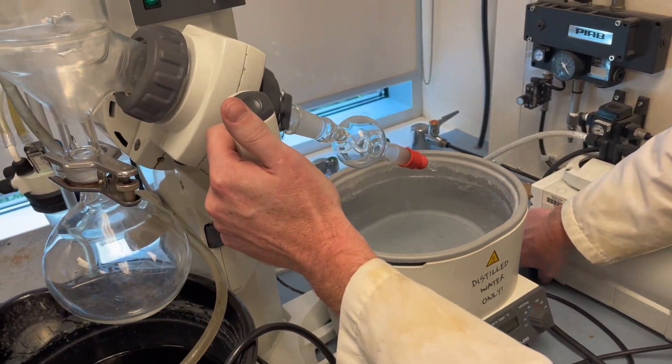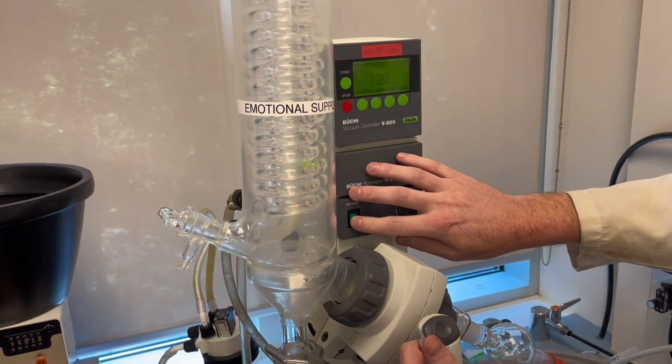We'll raise this up, turn our vacuum pump off, stop the rotation, turn off the power to the rotovap.